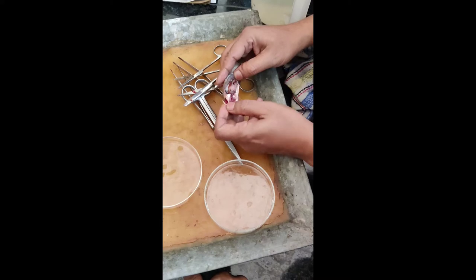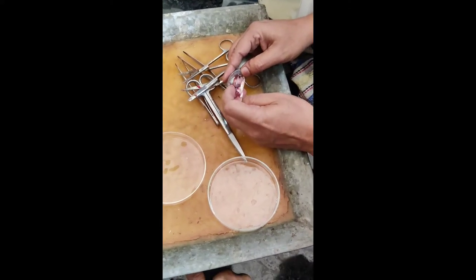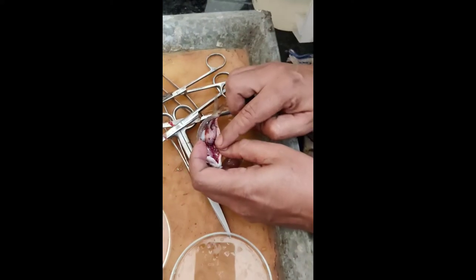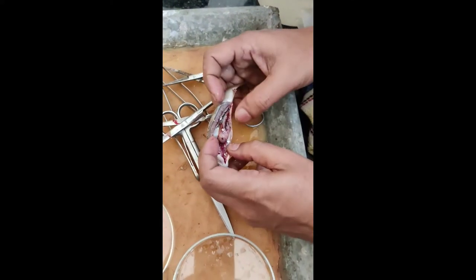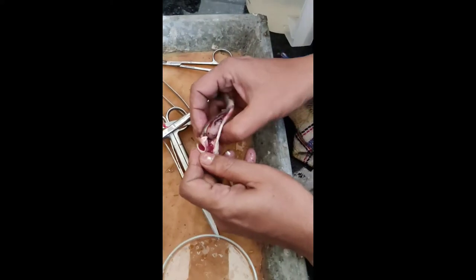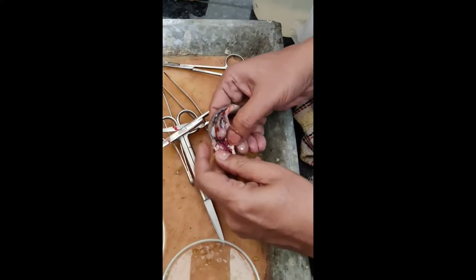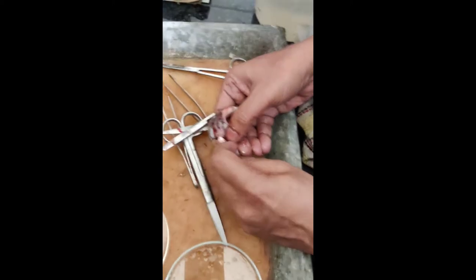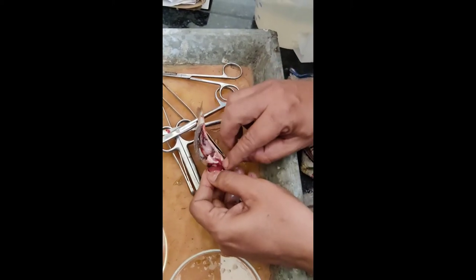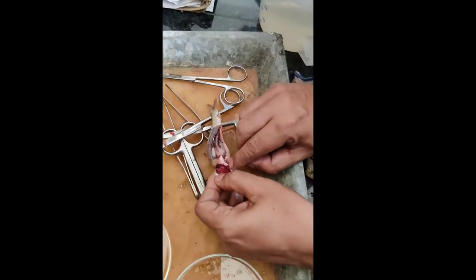Can you locate any organ? This is hard. It's very difficult to get the thymus. As I told you, the thymus actually resides in this location — this is the branchial cavity, this is the bottom of this side.